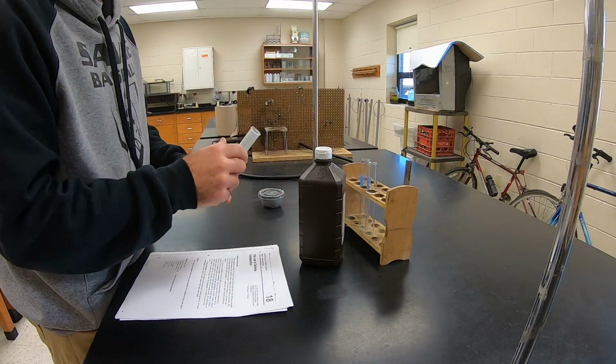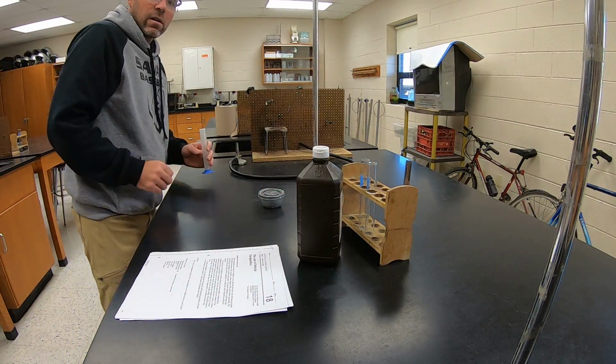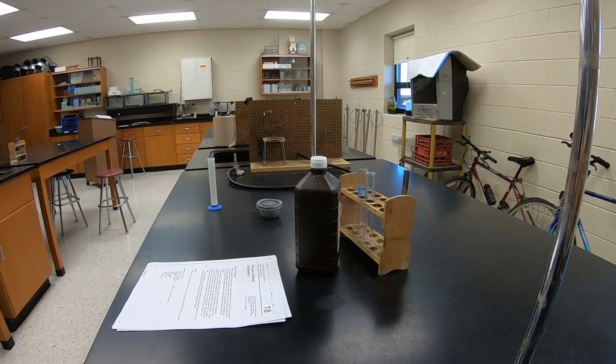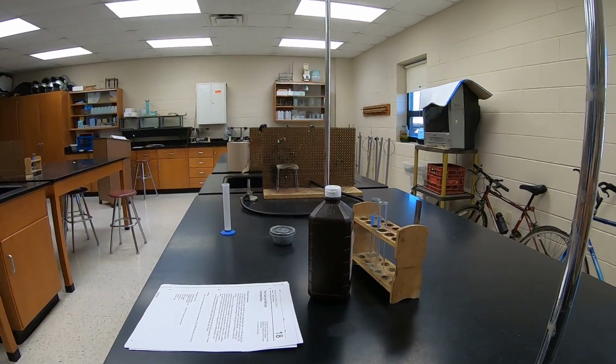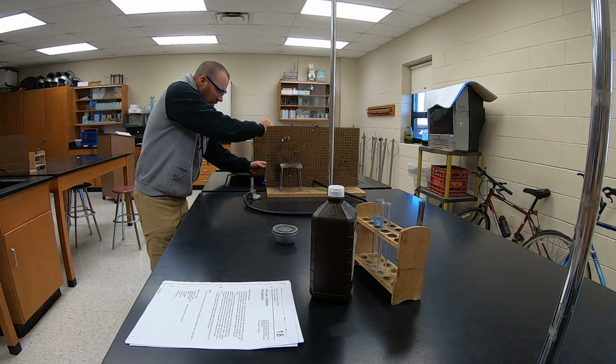So let's get this set up. So I need 5 cubic centimeters of water.